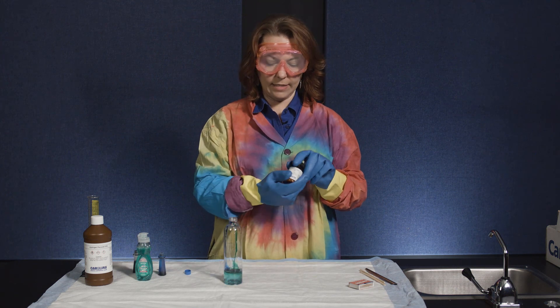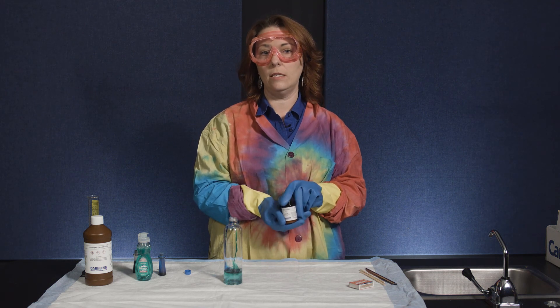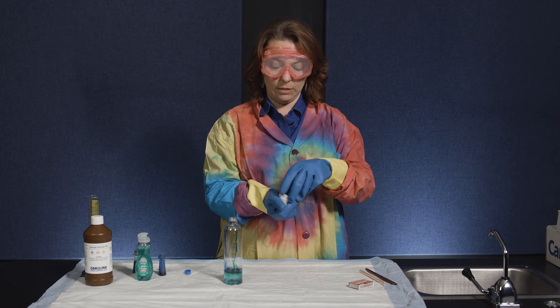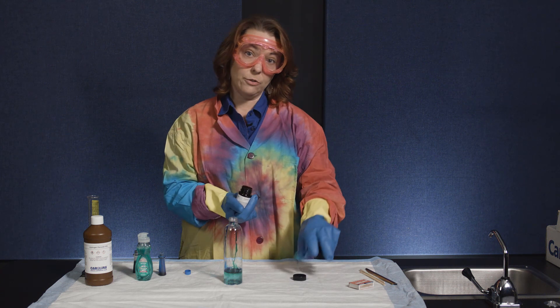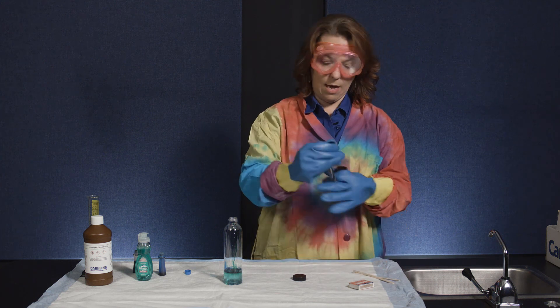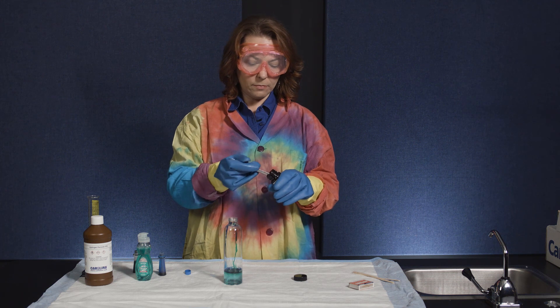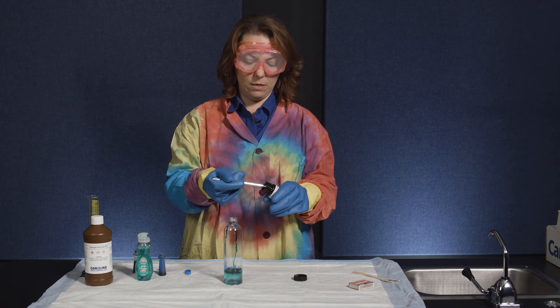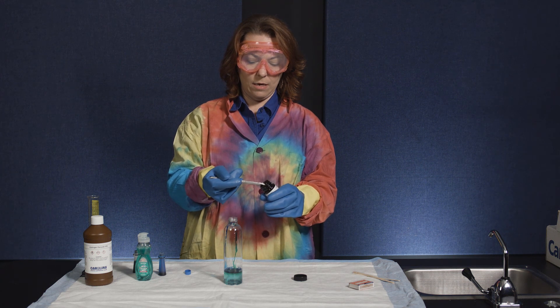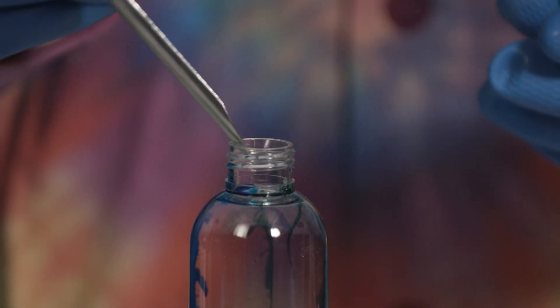The last thing we're going to add is our catalyst — solid potassium iodide. You can also use sodium iodide as a catalyst. If you have kids with iodine allergies, regular yeast will act as a catalyst as well. I usually use about a pea-sized amount of potassium iodide — this isn't exact. We're going to add it and see what happens.